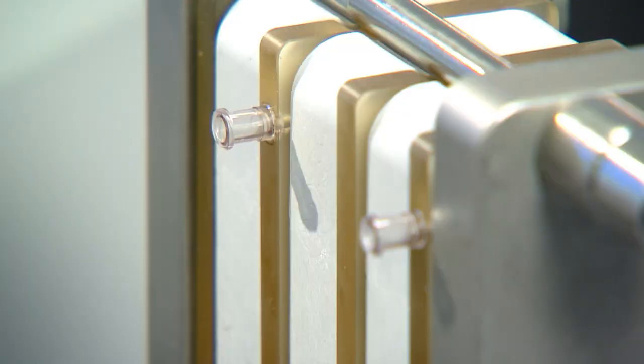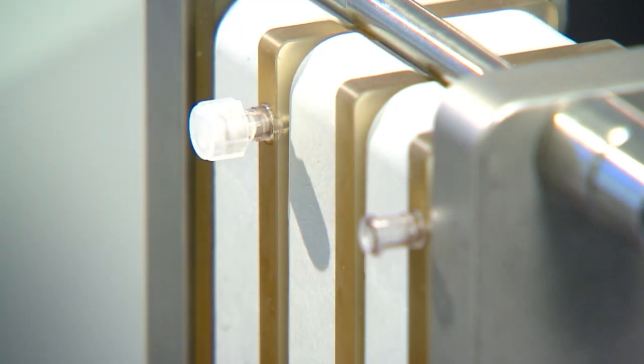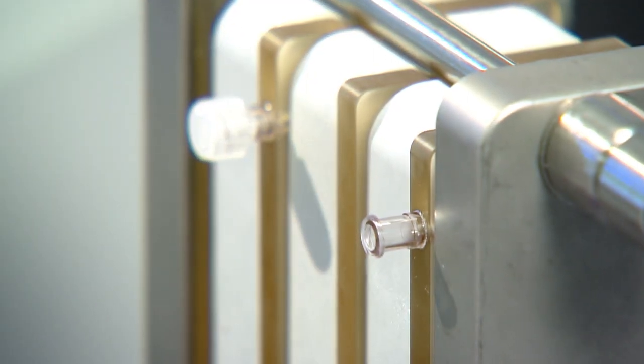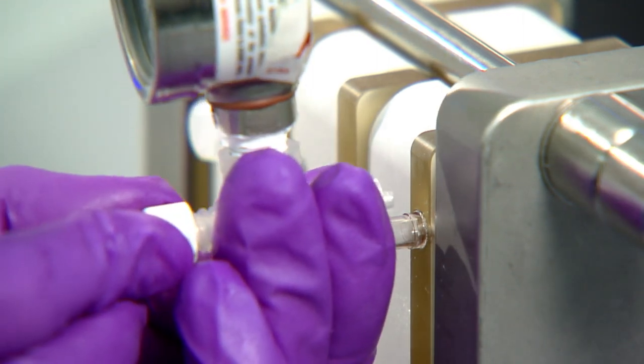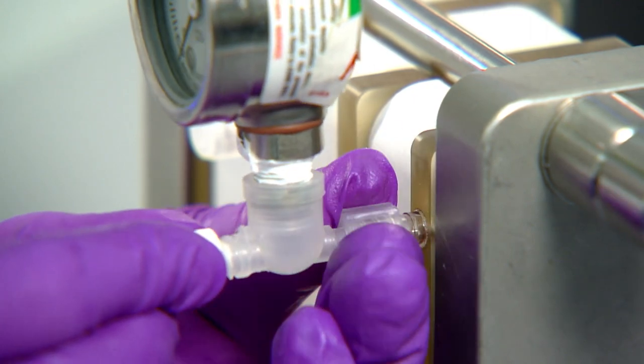On the front side of the assembly, you may cap off the retentate port from the second diverter plate. A pressure gauge can be installed for data collection if desired. A pressure gauge and hose with pinch clamp for controlling back pressure is installed on the retentate port of the fourth plate.